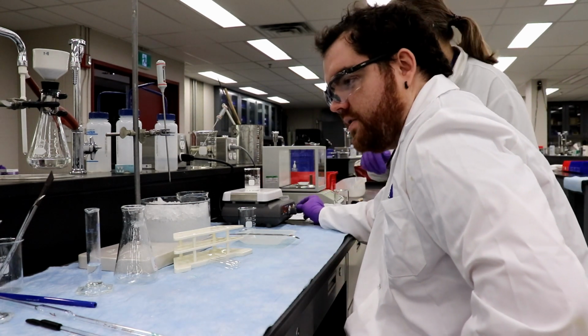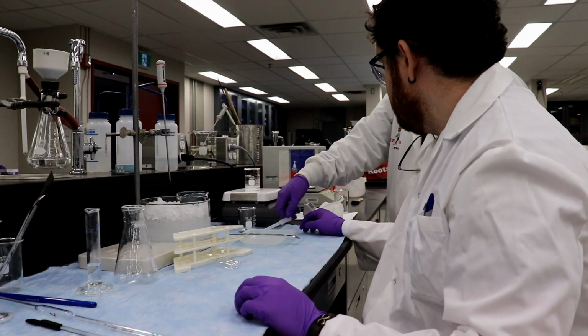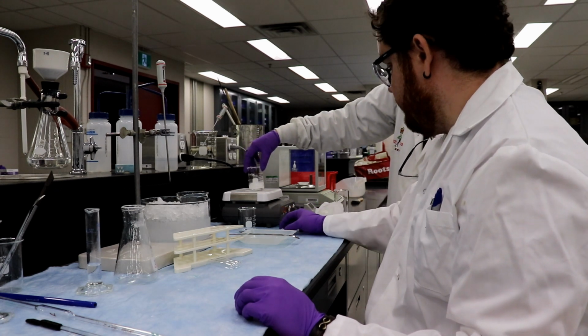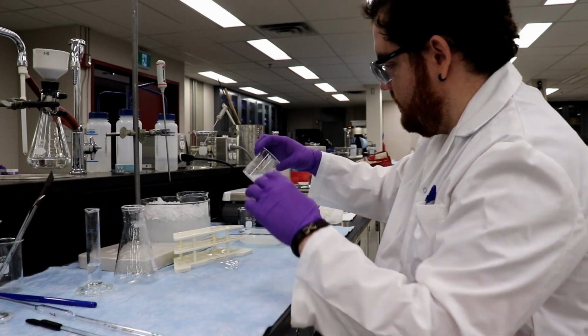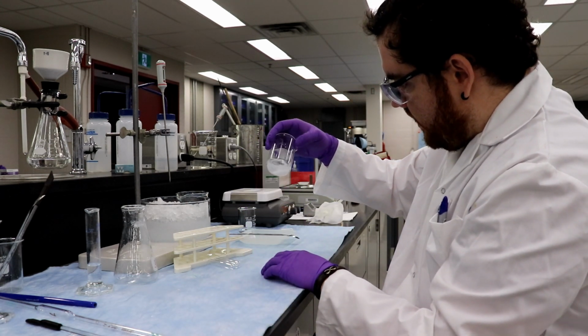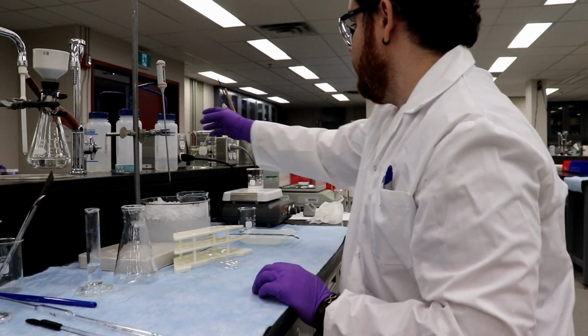So I'm going to suggest... Little plastic, or actually I can use this one. I don't want to lose stuff in there, I just want to wash the bottom. Oh, just going to pull it up and push down? You can probably do this. So Ingrid brought up a good point. We have a lot of product that's sitting at the top right there, and we're going to want to wash that all down.